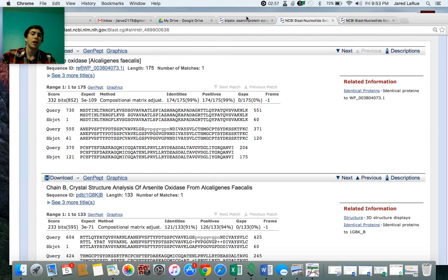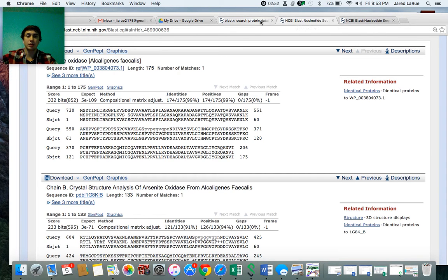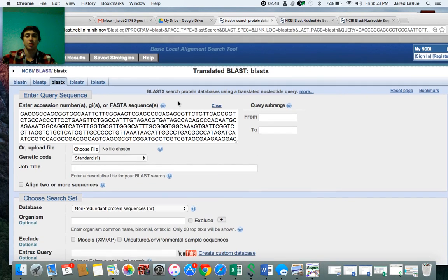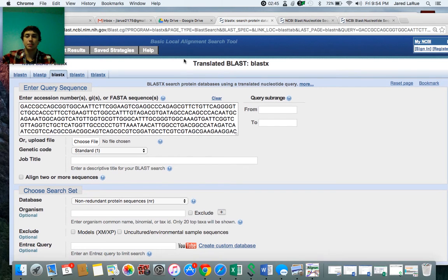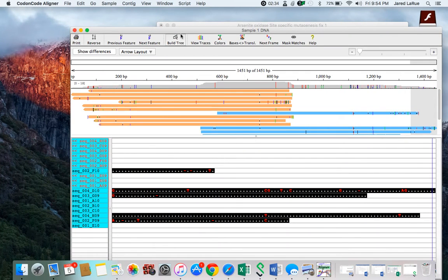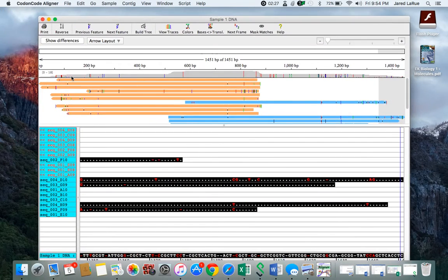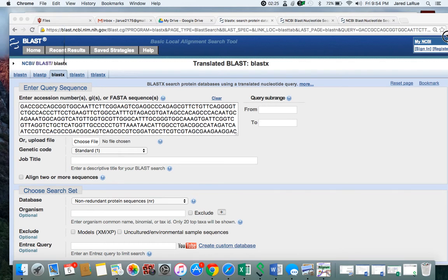So that is how to use the program, how to correct all those errors, and how to use it in conjunction with the NCBI database. Again, you can align two or more sequences if need be. It's all relatively straightforward. It's not too bad. I'm just trying to see if there's anything else I missed, which I do not believe I did.